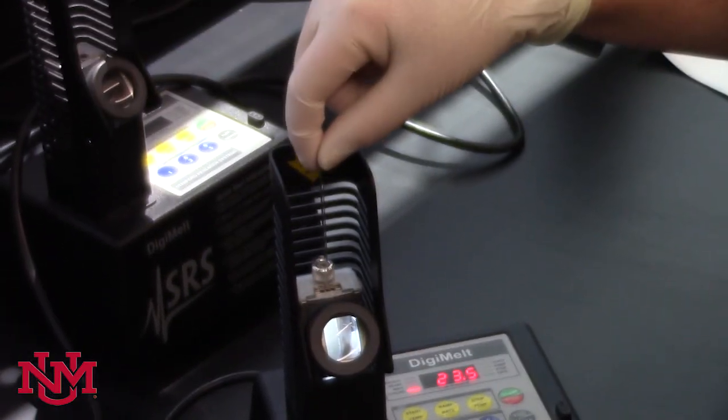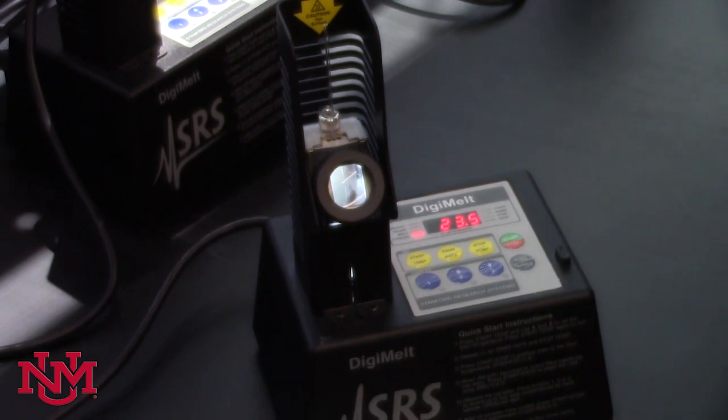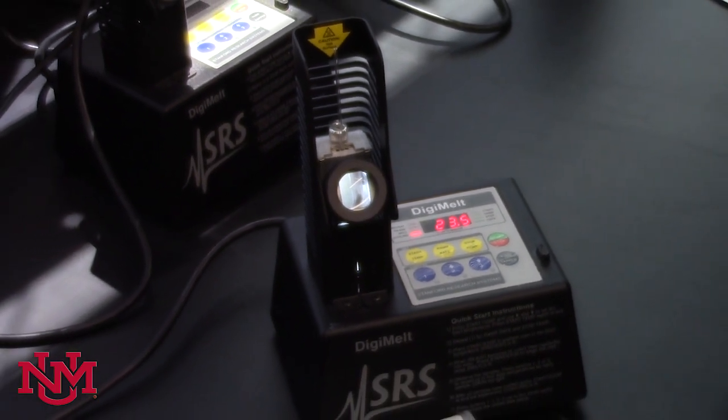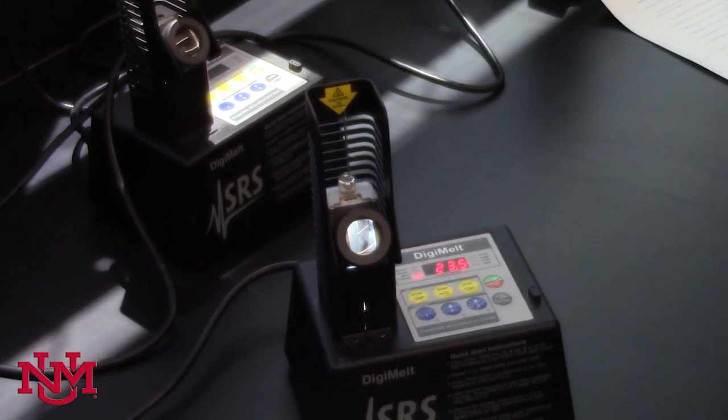After you obtain the melting point, you'll practice another technique which will allow you to get a little bit more information about the identity and purity of your samples from last week.